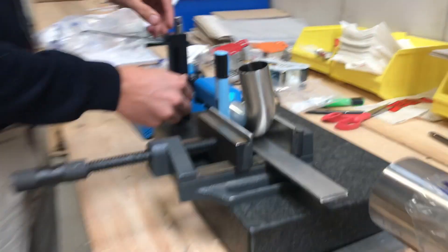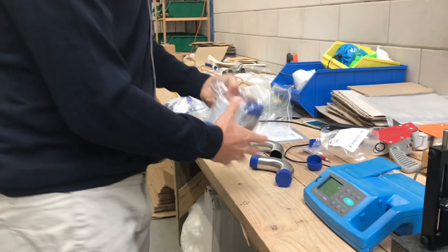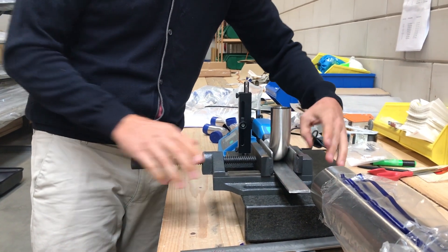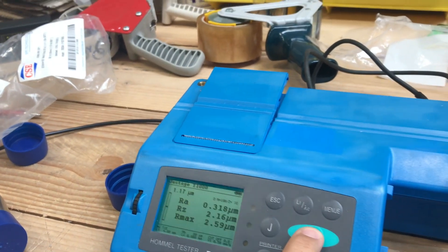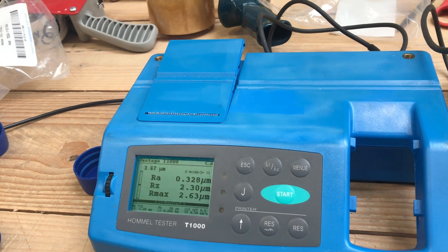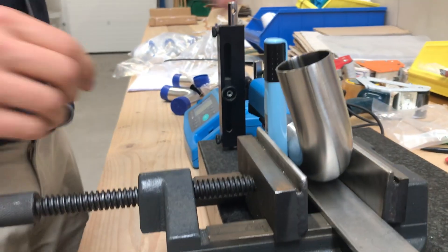We make another one for testing. We take randomly the same new one, fully in the box, completely closed. We measure straight now. Level down. 1.1 — center adjustment. 0.28, and we make again. 1.1 center adjustment, level it down.